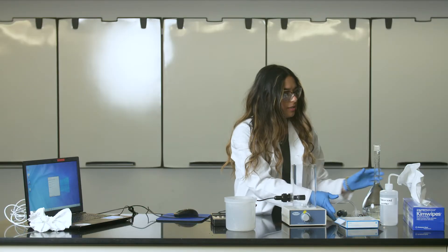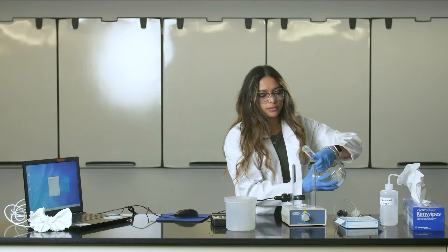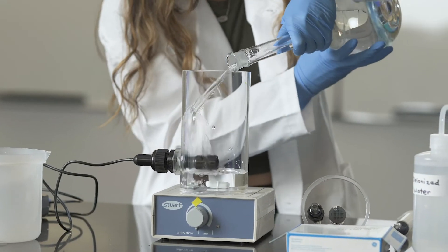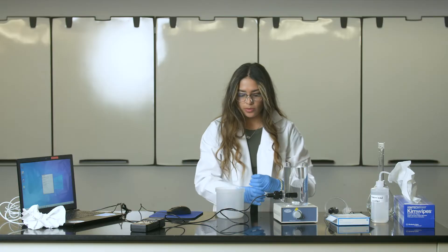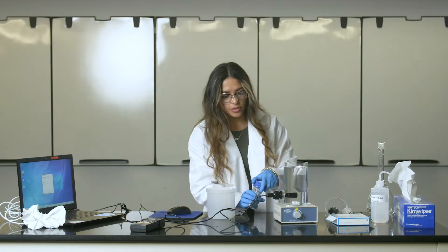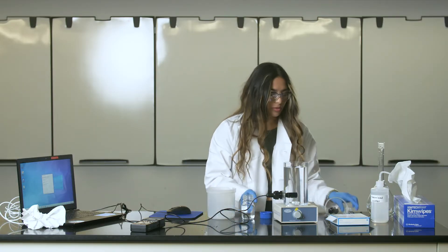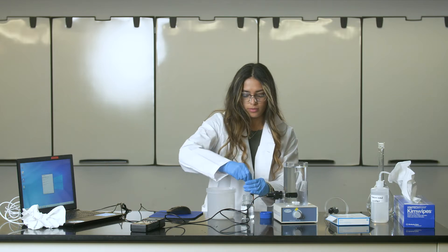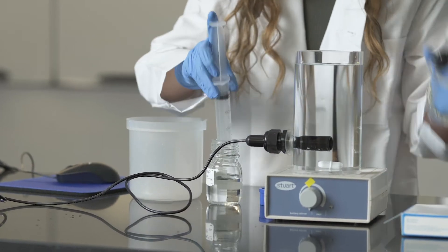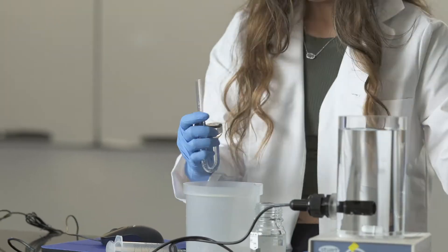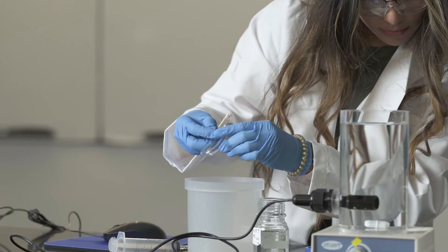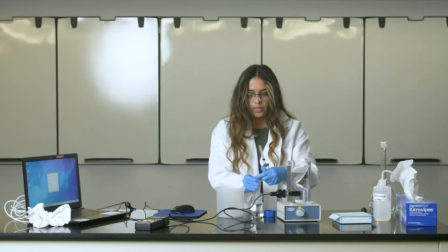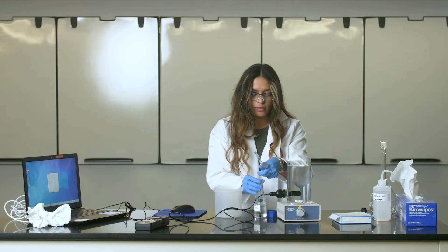Fill the vessel with a liter of water. Now we are going to rinse the inside of the diffusion cell with salt solution. And now we can fill the diffusion cell with salt solution.